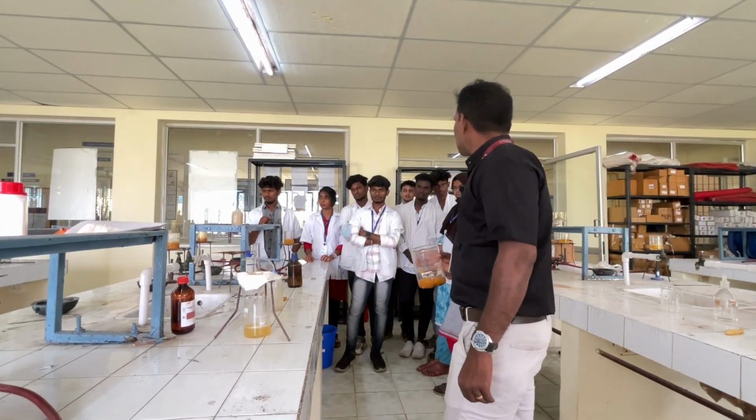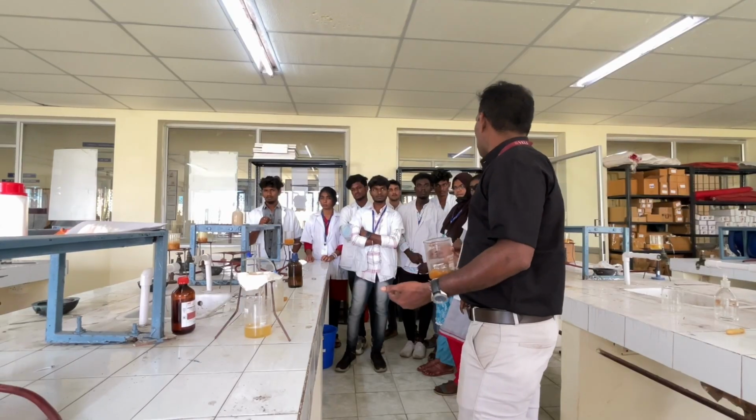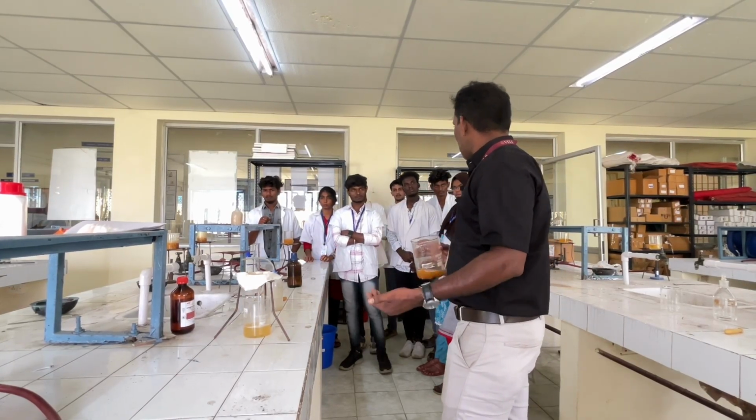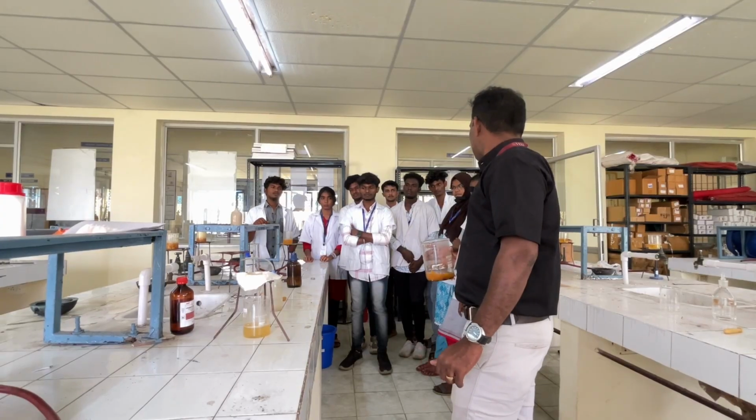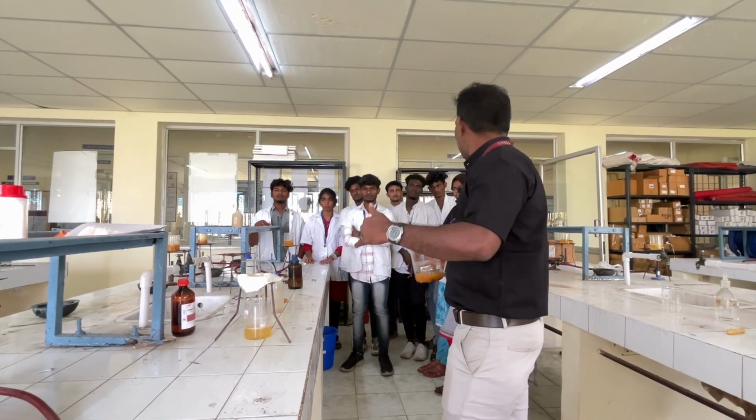So you can use isopropyl alcohol or ethyl alcohol or N-propyl alcohol for the precipitation of the pectin.